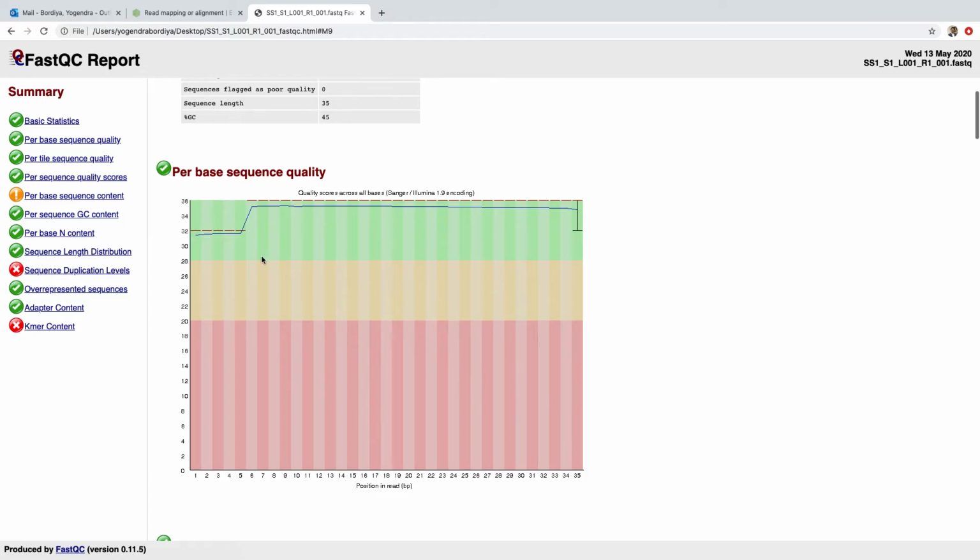In case, say you had first five bases or last few bases with a really low quality somewhere here in yellow or red region, the next step would be to trim the fastq file. So you can trim those first five base pairs or last five base pairs.